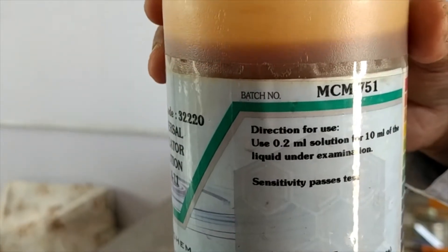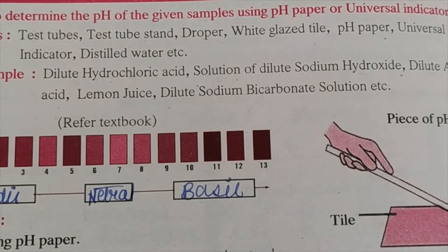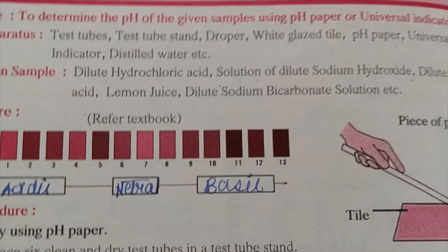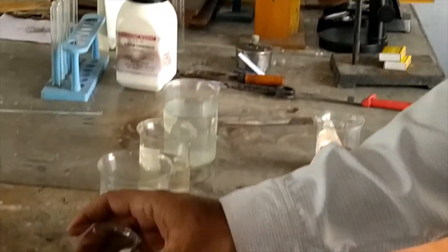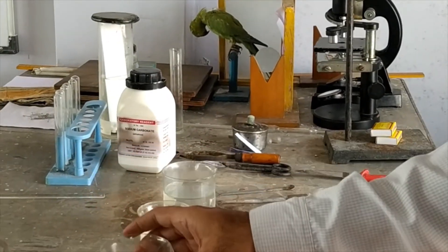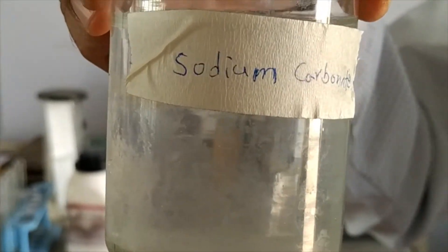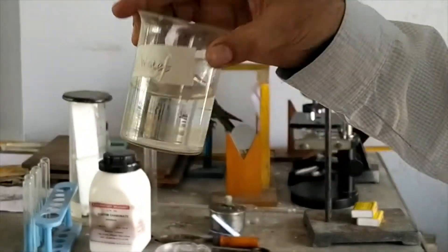So this is universal indicator. The given samples are dilute hydrochloric acid, dilute sodium hydroxide solution, dilute acetic acid, lemon juice, and dilute sodium bicarbonate solution. Now I will show you the solutions first. This is dilute hydrochloric acid, this is dilute sodium hydroxide solution, the third is lime juice, the fourth is sodium bicarbonate, and water.